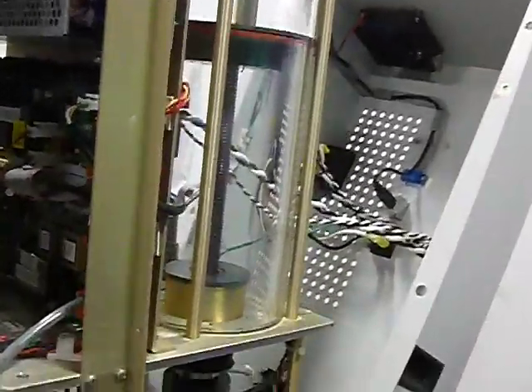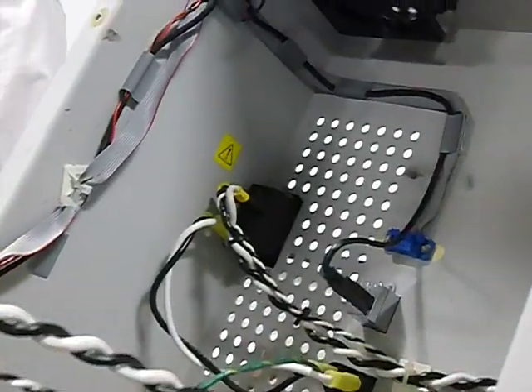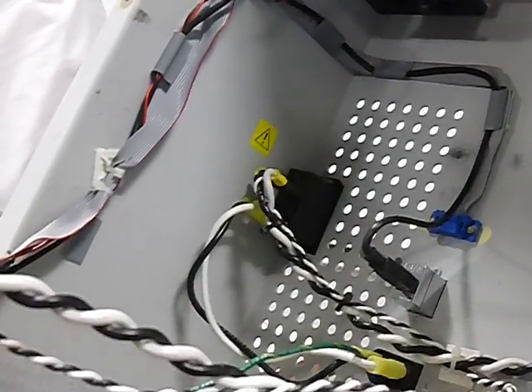Come on, I know you're in here somewhere. No. Let's see quickly, with the measurements. High pressure. It's too much high pressure. All right, and that's because maybe I took this apart.